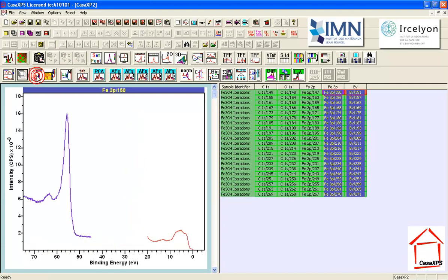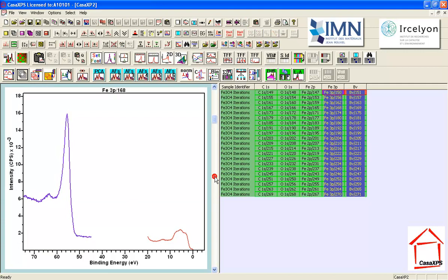If I display these in tiles in the scroll list, so there's an Fe3P and corresponding valence band spectrum in each one of these tiles, this is the state that will allow me to use the toolbar button that says Merge Irregular to create a new VAMAS file that will be based on each and every one of the tiles that we see in this scroll list, in which we've got an Fe3P and a valence band spectrum displayed.